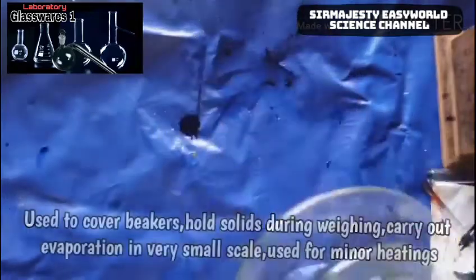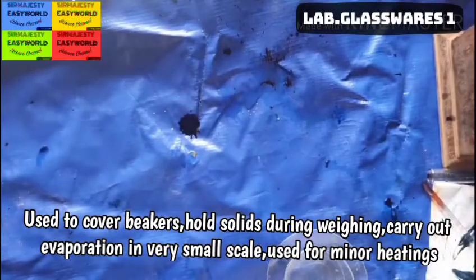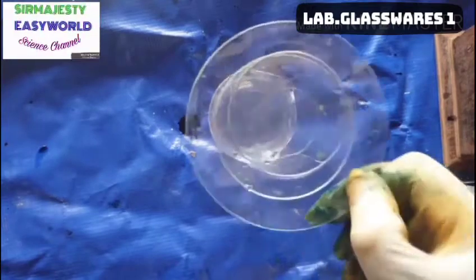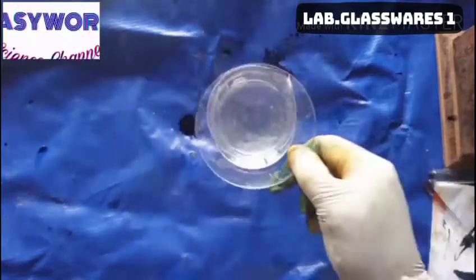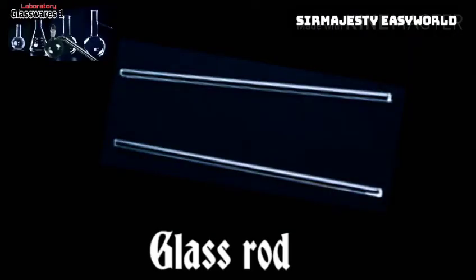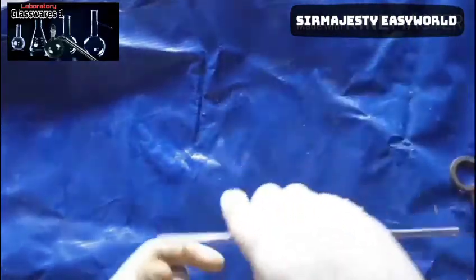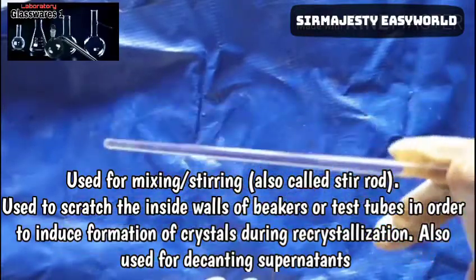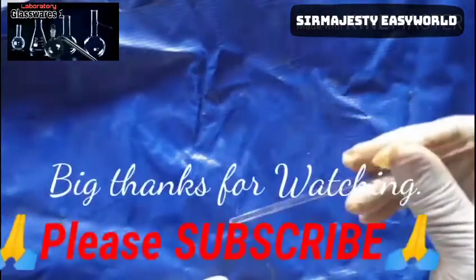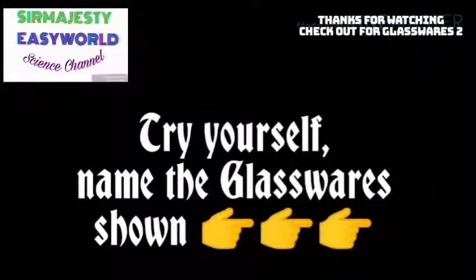Here is the watch glass. You can see its many uses on screen — it comes in different sizes and is commonly used to cover a beaker. Here is the glass rod, used for stirring mixtures and other uses as shown on screen. We hope to continue with a Part 2 of this video where you'll see other glassware like the Soxhlet extractor.